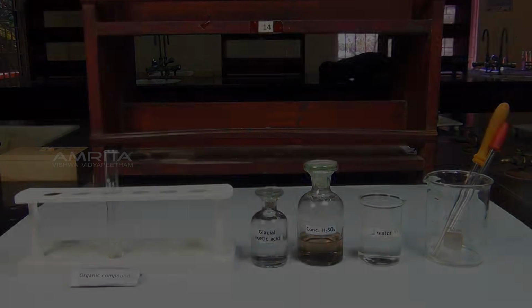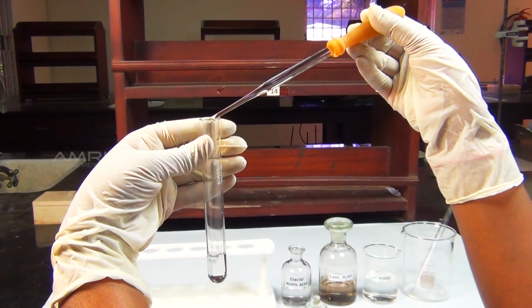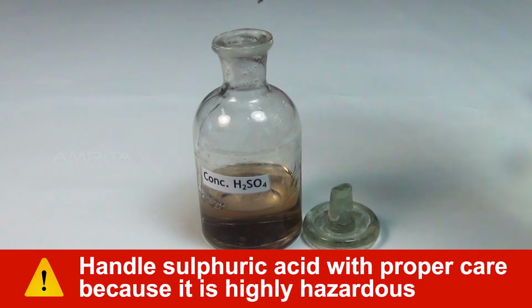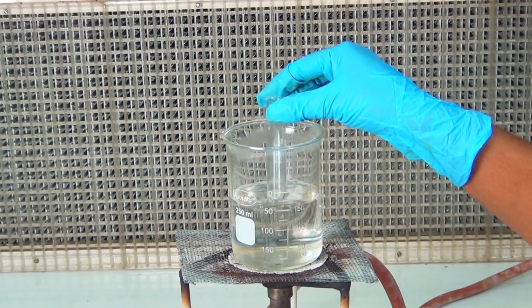Procedure: take a small quantity of organic compound in a test tube. To this, add a small quantity of glacial acetic acid using a dropper. Using another dropper, add a few drops of concentrated sulfuric acid to the test tube. Warm the mixture in a water bath for a few minutes.